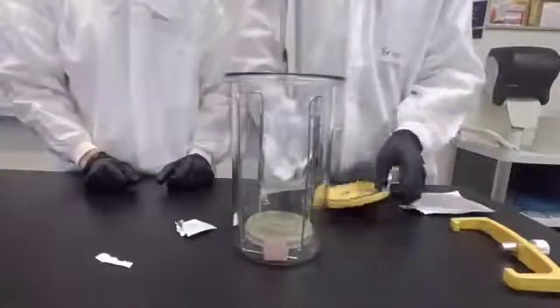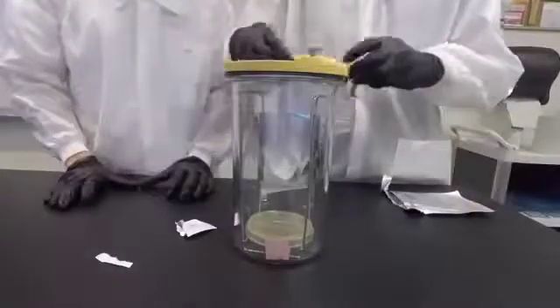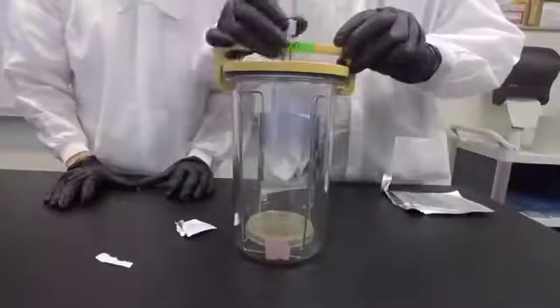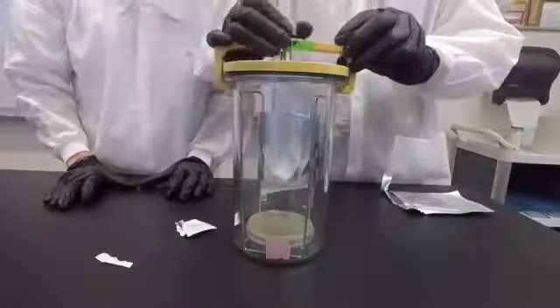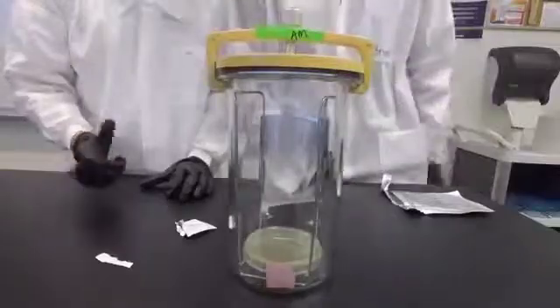The jar is now ready to be sealed. Make sure to seal the jar tightly and ensure gas cannot get into or out of the gas pack. The entire gas pack will be placed into the incubator at 35 degrees Celsius for 24 to 48 hours.